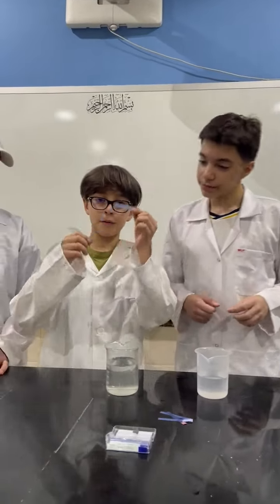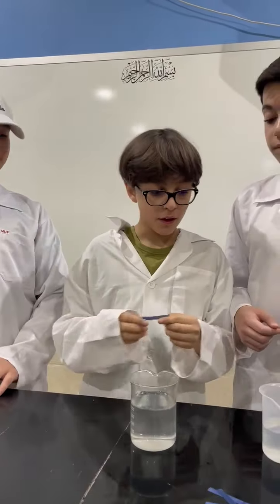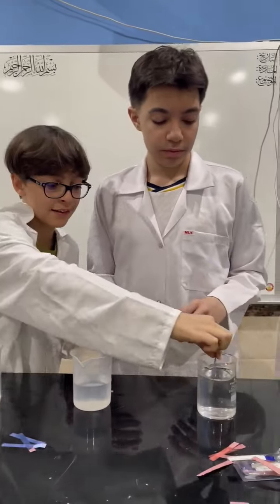And if you're gonna ask about the paper, it's litmus paper. That's color, that's blue. That's why if you put it in acid, it turns red.